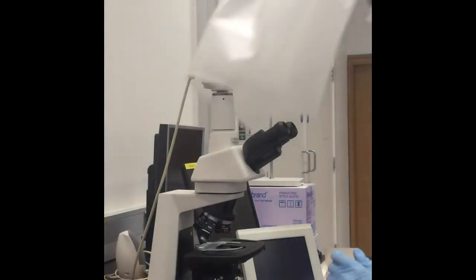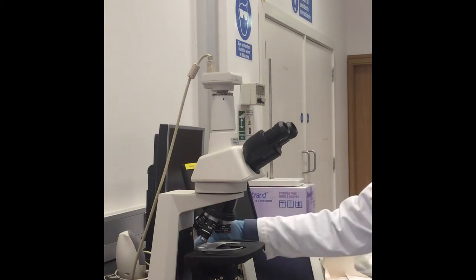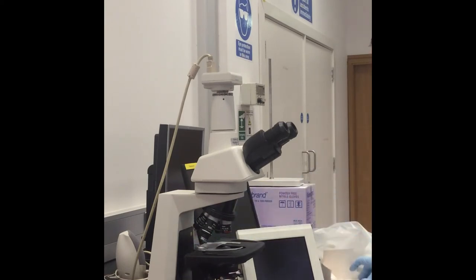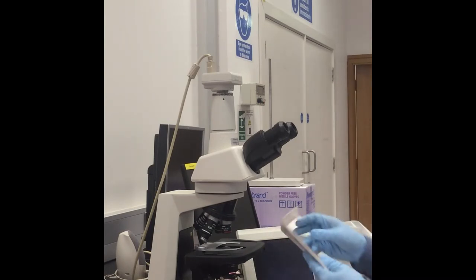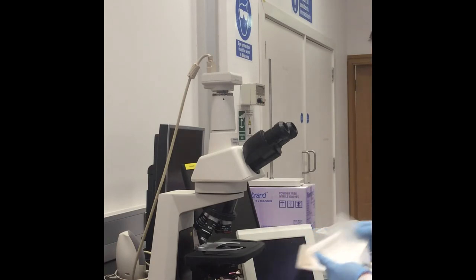The sample is now ready for viewing. Remove the cover of the microscope carefully and turn on the microscope from the button on the side. Using the microscope lens paper, clean the binoculars of the microscope and also use it to clean the magnifying lenses.